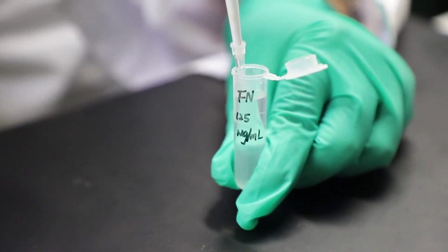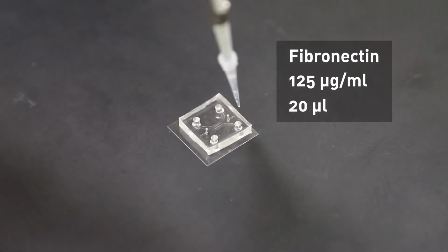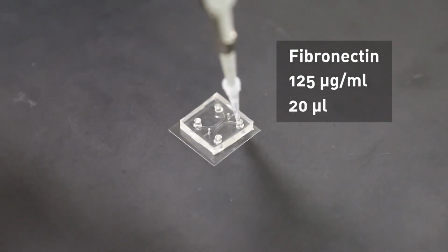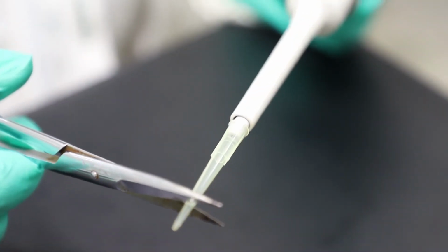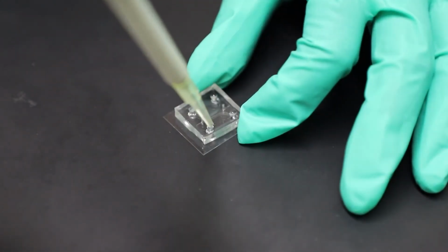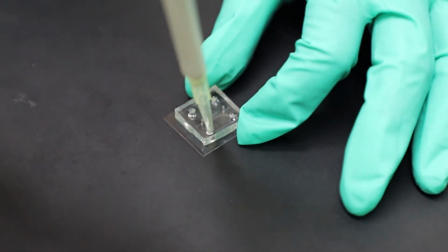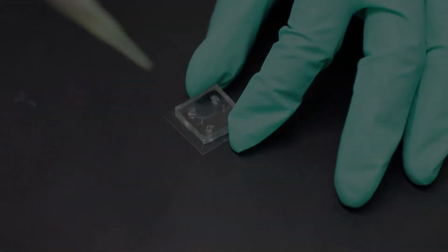Pipette 20 microliter of 125 microgram per milliliter fibronectin into 1 media injection port of the cell culture channel. Cut a pipette tip to fit the port of the cell culture channel with scissors. Insert the pipette tip into the other media injection port of the cell culture channel. Then pipette out air from the cell culture channel to fill it with fibronectin.